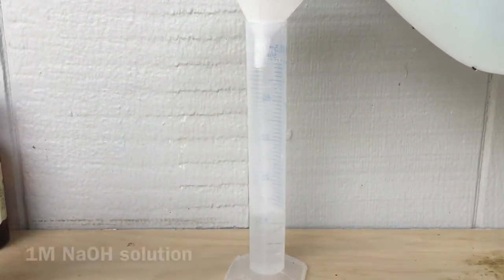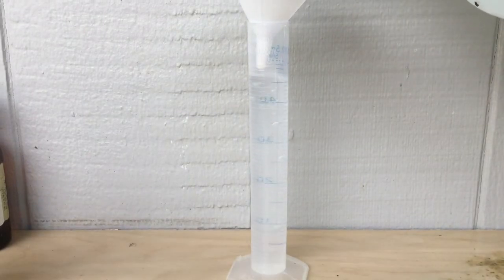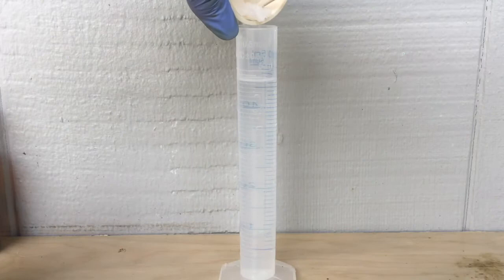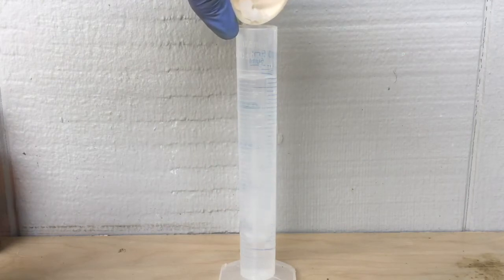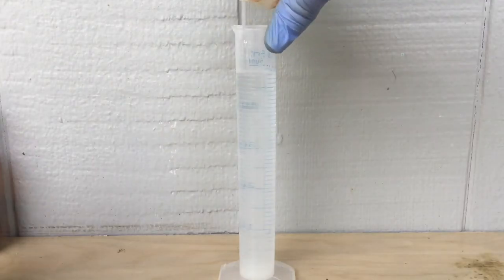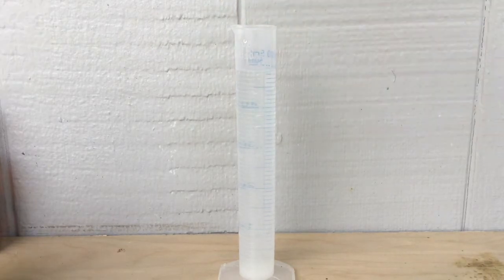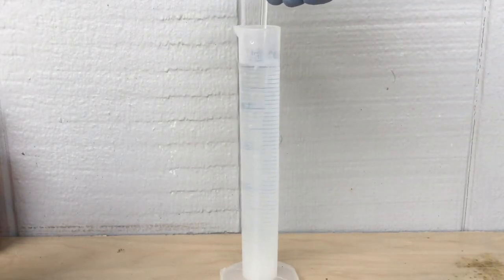The next thing I'm doing is measuring out some water so that we can make a one molar sodium hydroxide. When I pour in the water, I also add the sodium hydroxide, and eventually I'll fill up the solution to the 50 milliliter mark. That makes a one molar sodium hydroxide solution that we can titrate the sulfuric acid with.